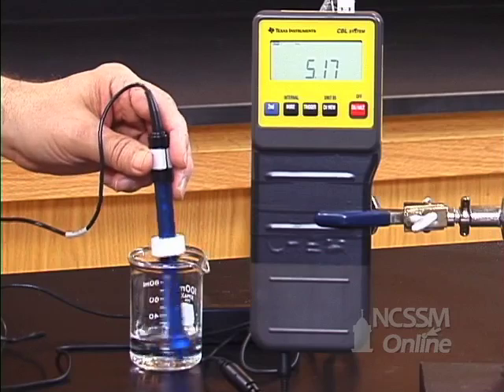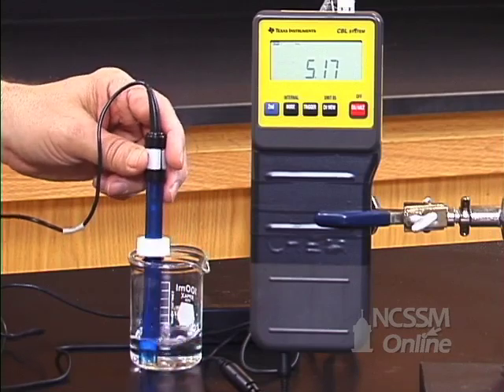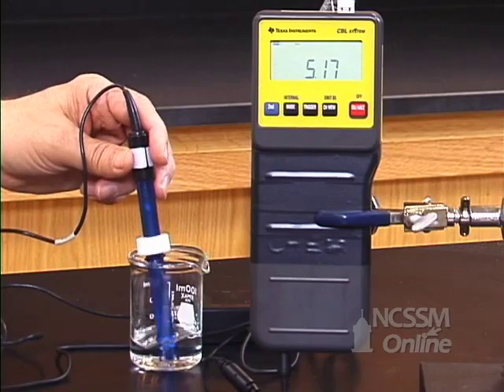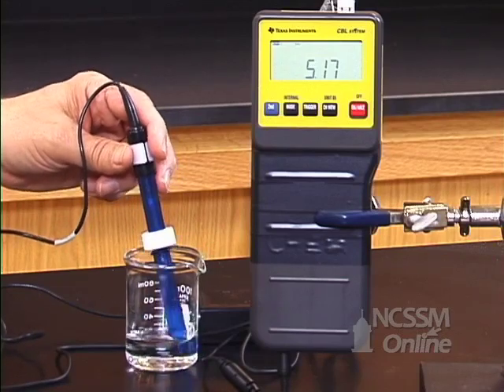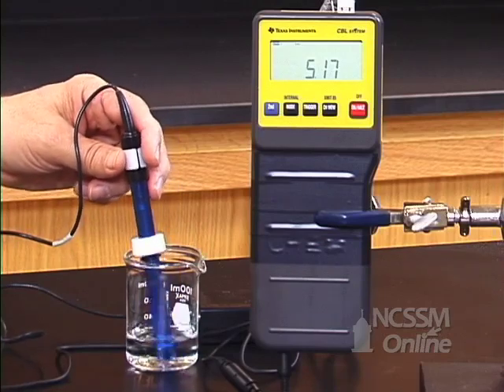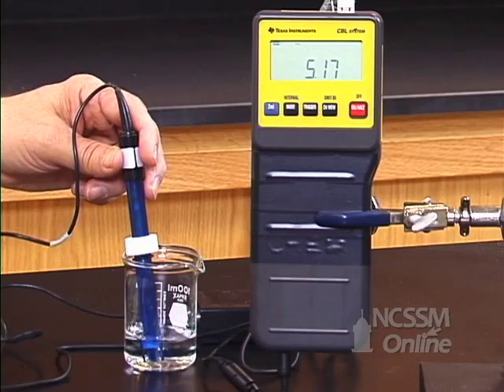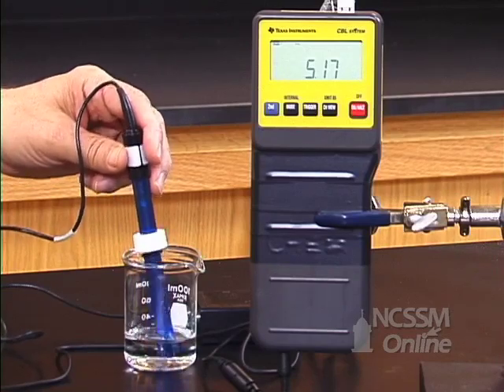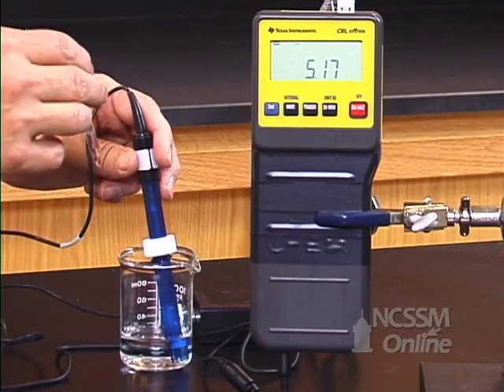After 10 drops, the pH is slightly higher. Again, the buffer does not maintain absolutely constant pH — it just moderates or keeps the pH change relatively small. Notice that the pH is going up as I add the strong base.